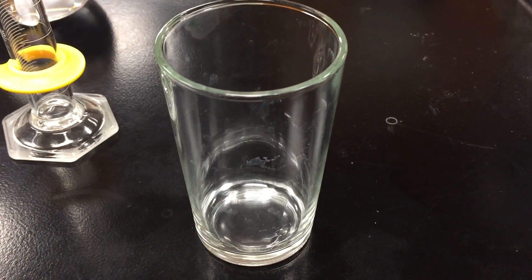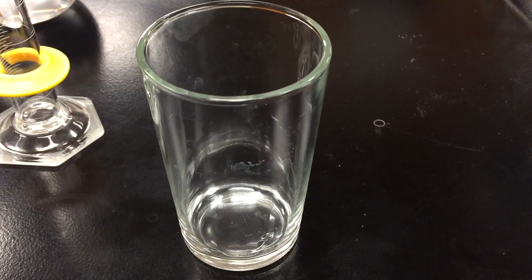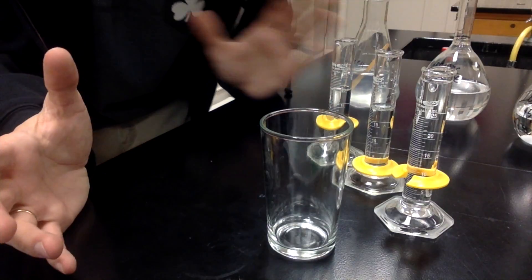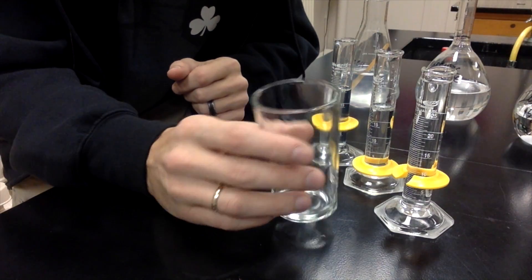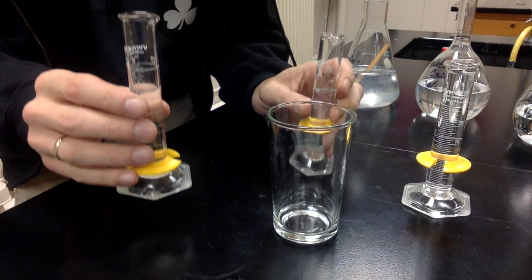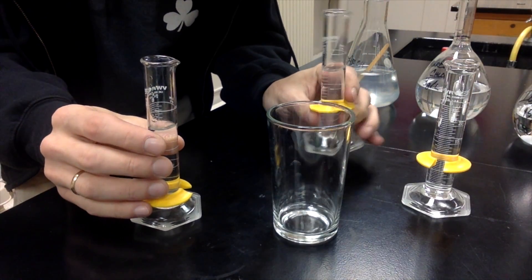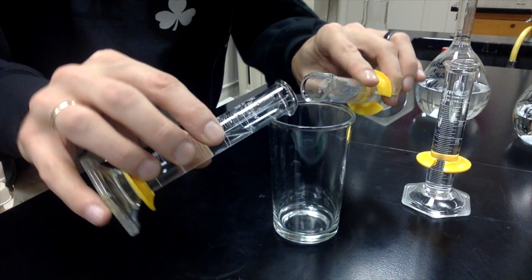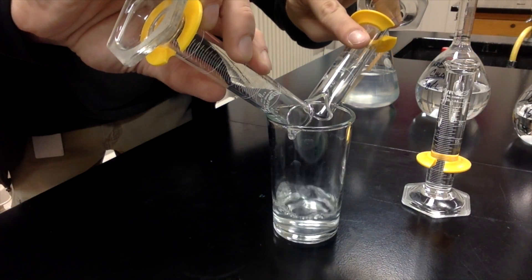So I'm gonna focus our attention onto that and get some things measured up here, and then I'll show you this amazingly cool reaction. All right guys, so here we go. I've got everything measured out and I've got my glass. I'm gonna mix just a couple of these liquids together first. We're mixing the starch and metabisulfite solution with the mercuric chloride and absolutely nothing happens.